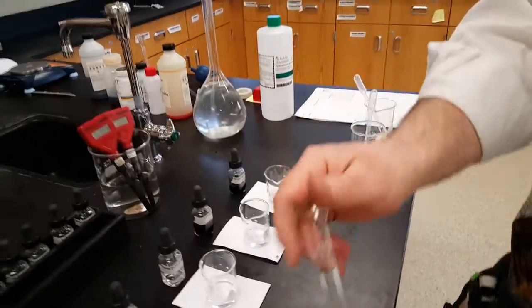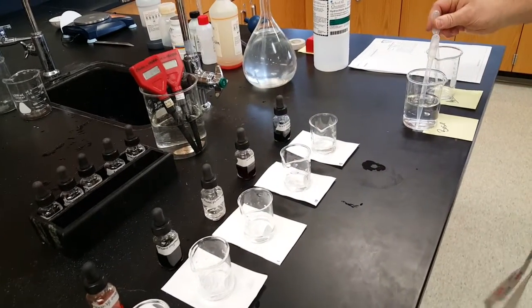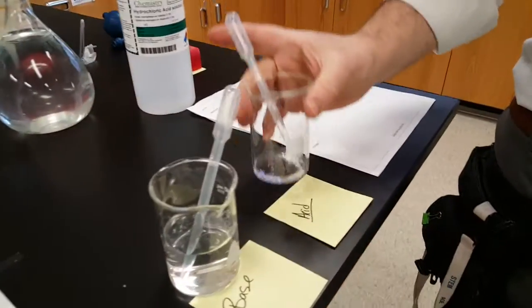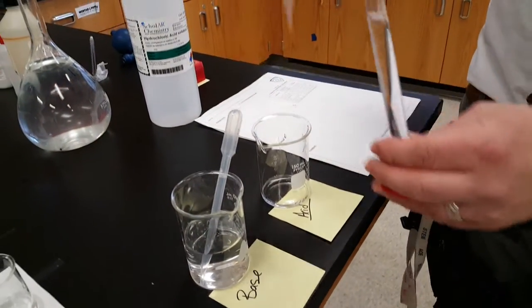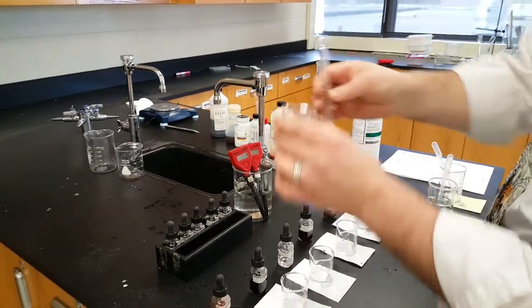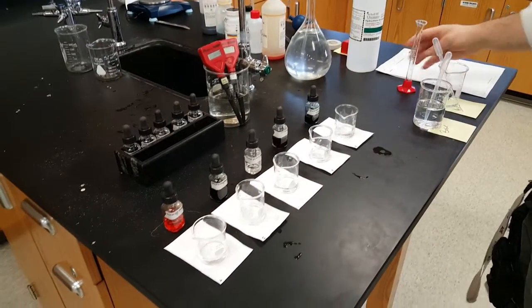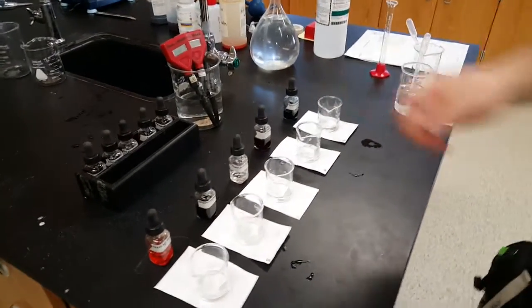Sweet. How much acid goes in each, Mr. Monaco? Well, 10 milliliters. The acid will be prepared for you. You should get a beaker, label it acid, put a pipette in it, and measure out your acid. I had a little too much in here. Bottom of the meniscus, boom. 10 milliliters, ding. And I'll put it right in there. I did that five times, so I have five 10 mL samples of acid. Okay, now what do we have to do?